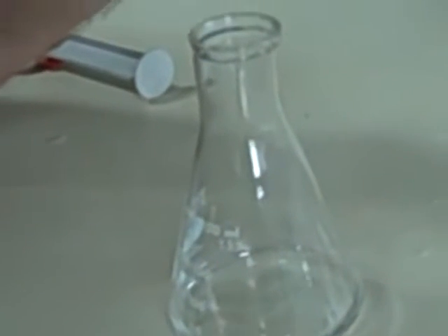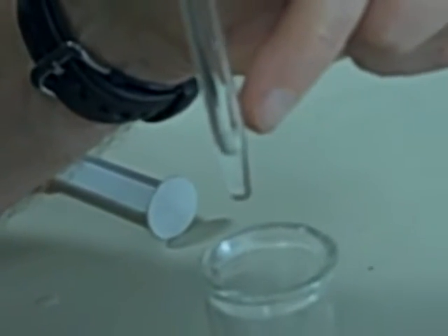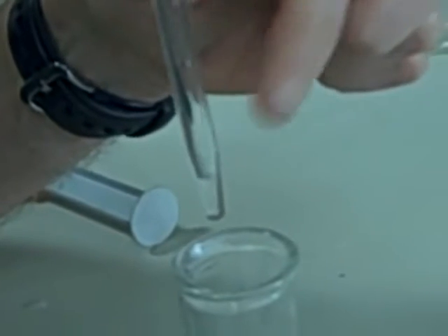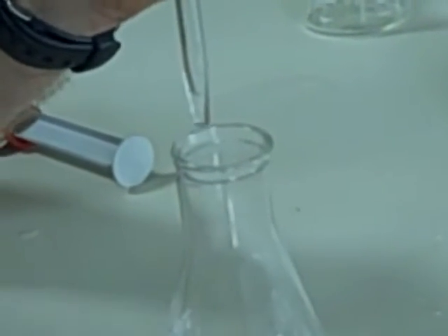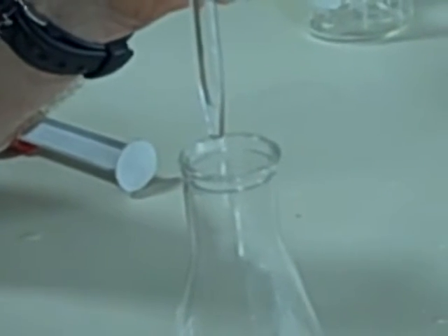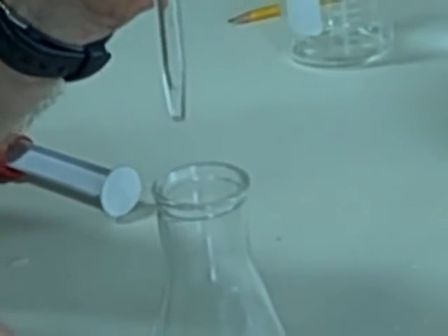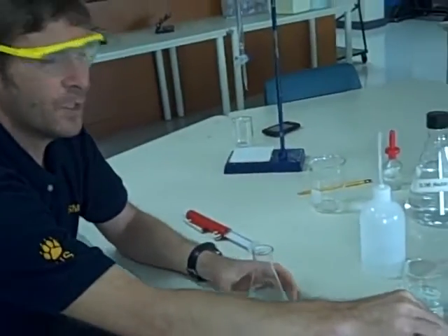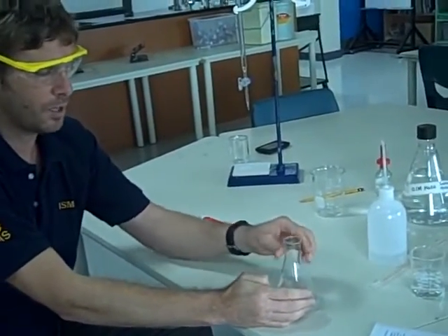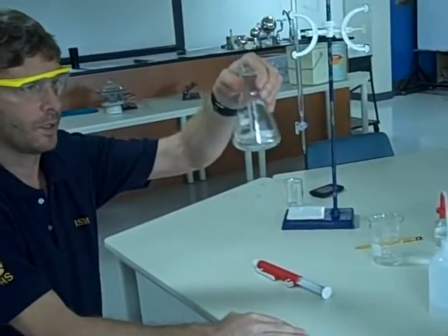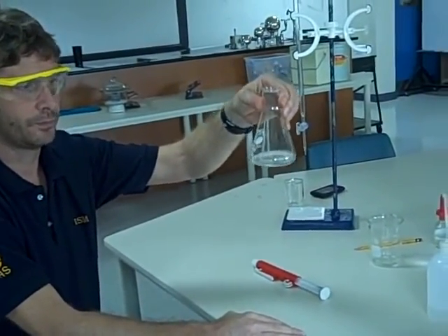If you look at the bottom of my pipette, you'll see there's a few drops in there. We are not required to blow those out or force them out. All I do is tip the surface of the liquid once, twice, and that withdraws most of it. And these pieces of apparatus are calibrated so that there's meant to be a drop left in. So I know now that I have added precisely 25.00 cc's of 0.100 molar sodium hydroxide to here. Okay, let's stop.